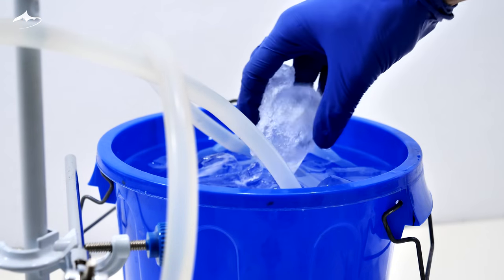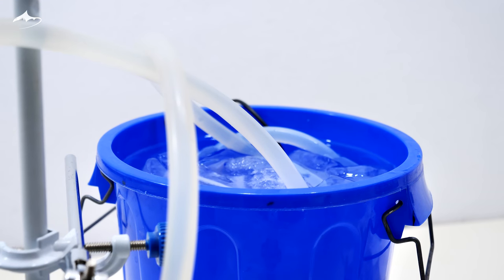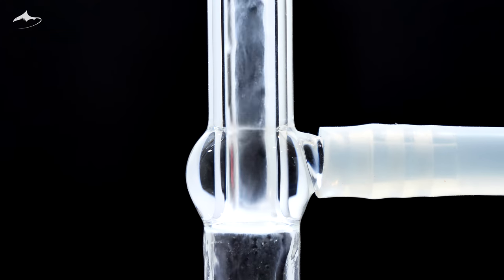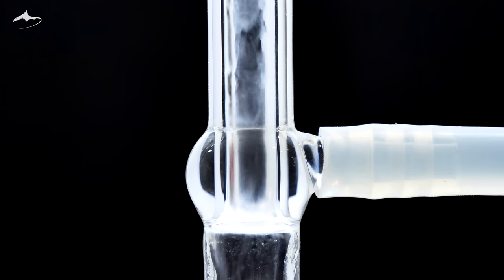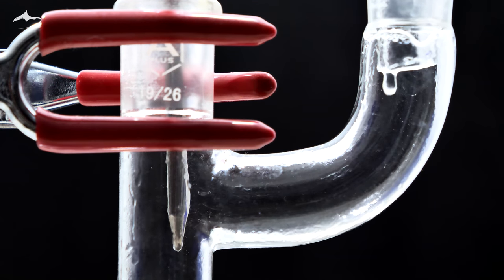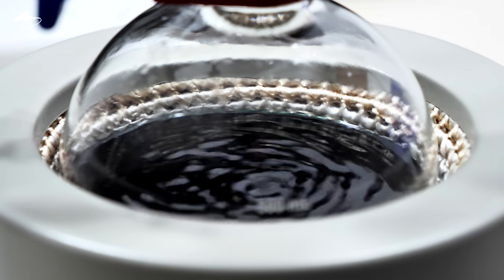I had to add some ice to the water circuit to counteract the fumes. After that, the condenser begins to work properly. Two hours later, the reaction is completed.